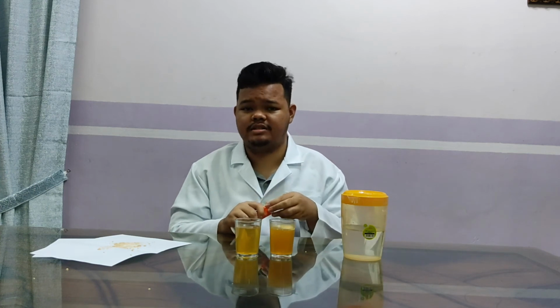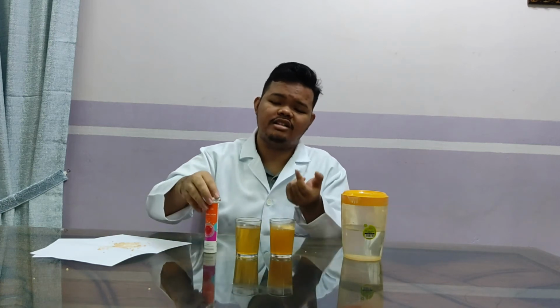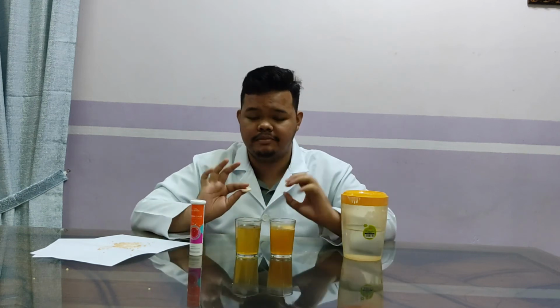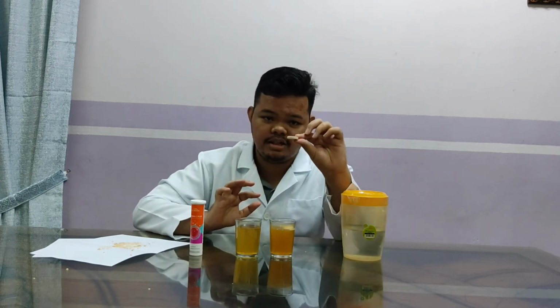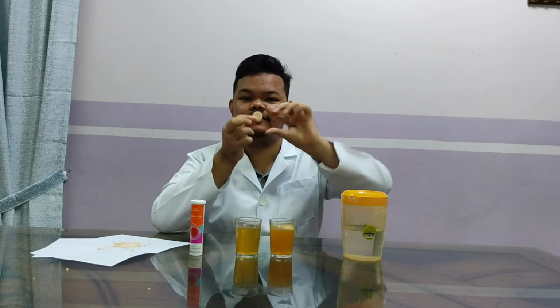surface area. So back to the question at the first of the video. How does the surface area affect the rate of reaction? Okay, make it simple. As you can see, this tablet has 3 surface areas before I cut or crush it. The first surface area, 1, 2, and 3.